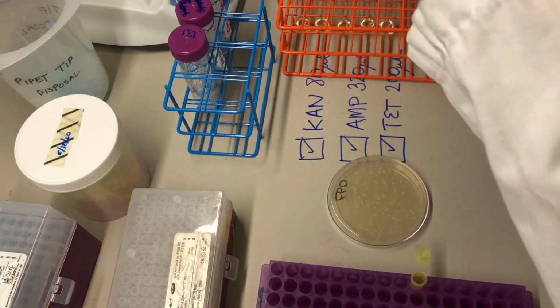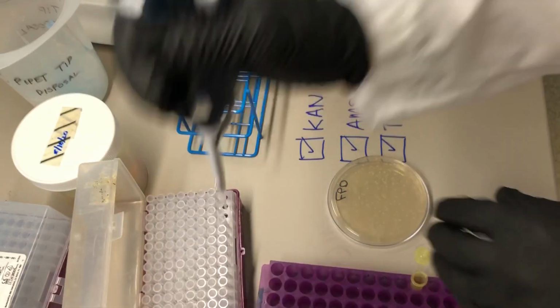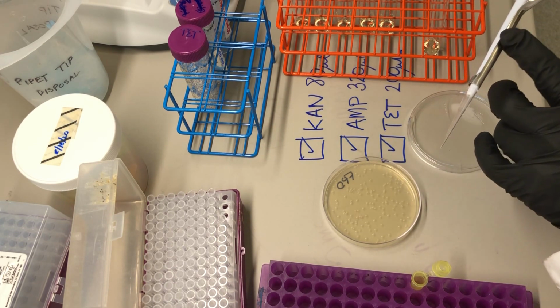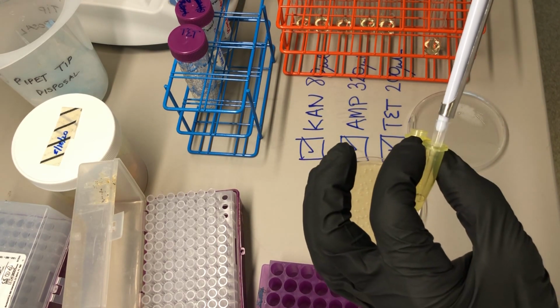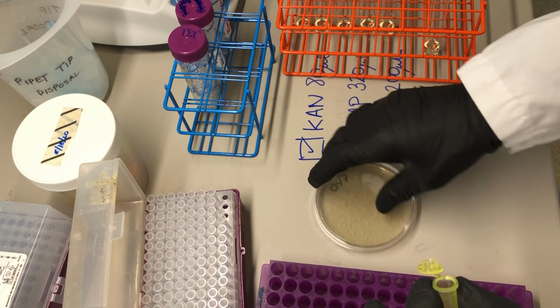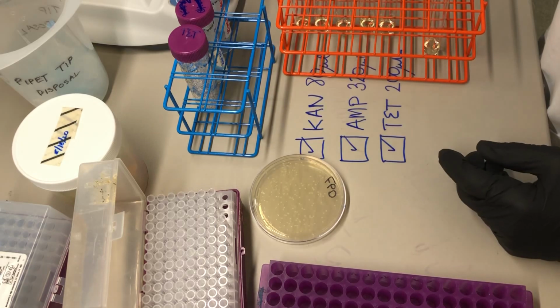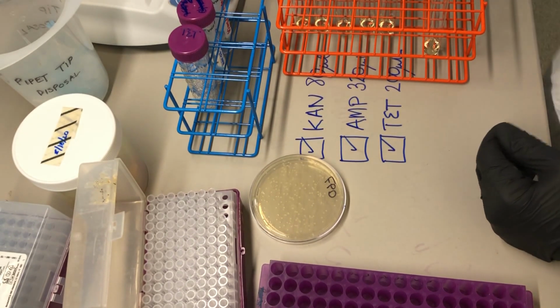Now we need to pick up the colony. I'm going to dial in a smaller volume, get a fresh tip, and it really doesn't matter which one I pick. And this time I don't really need to get the whole colony. I just want to pick up the cells from the plate, verify that they're on the tip, and then I rinse the cells into the solution here. Just like we did for count cells. And so the cells are now sitting in this 100 microliters of solution. You can vortex the cells if you're worried about getting them all distributed, but pipetting up and down probably just did a fine job.